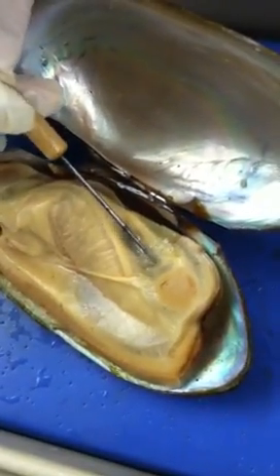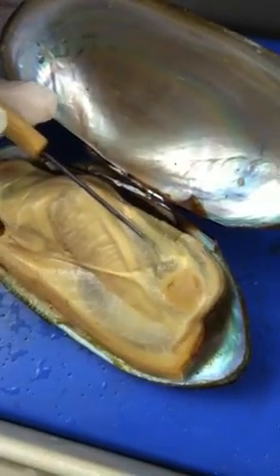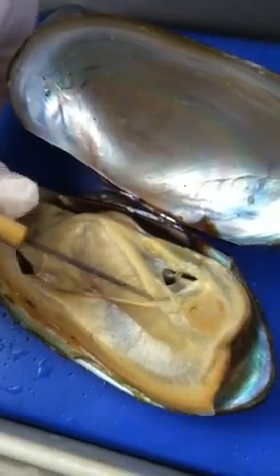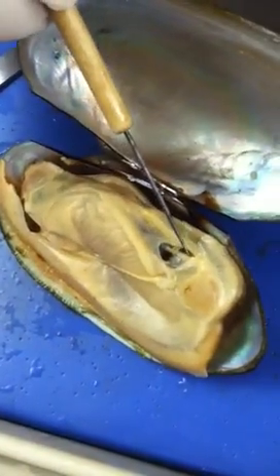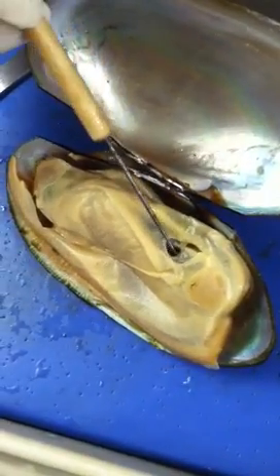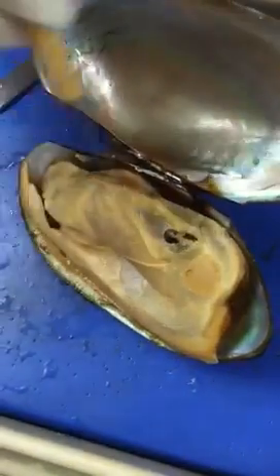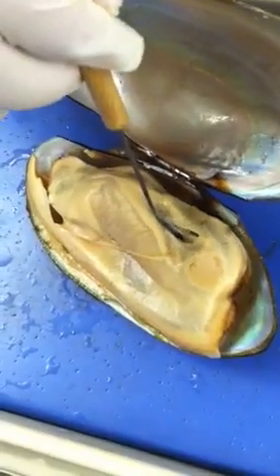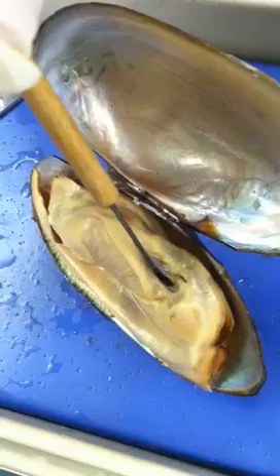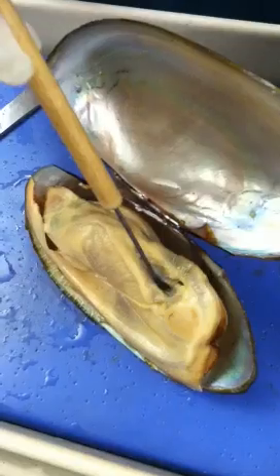Because there are three chamber structures, let me remove the pericardium carefully to expose the inner structure. The whitish structure will be the ventricle, and the lining inside the pericardium is actually the atrium. On the bottom, you will see a black structure — that's the kidney. In this lab, every organ that's black will be the kidney, so that's a good hint.